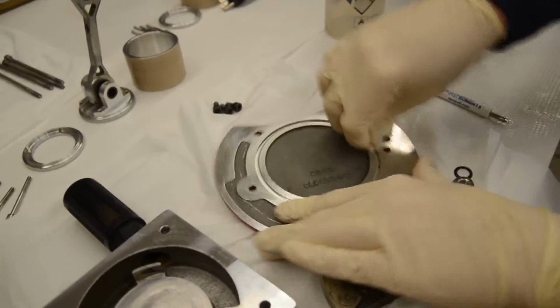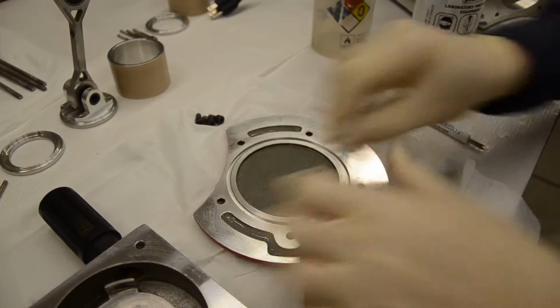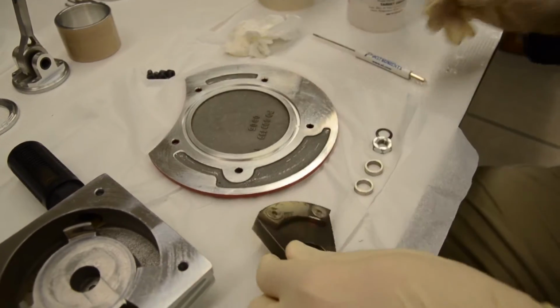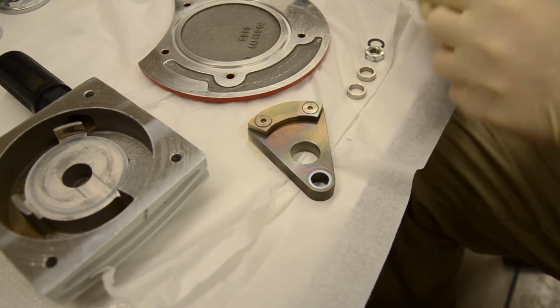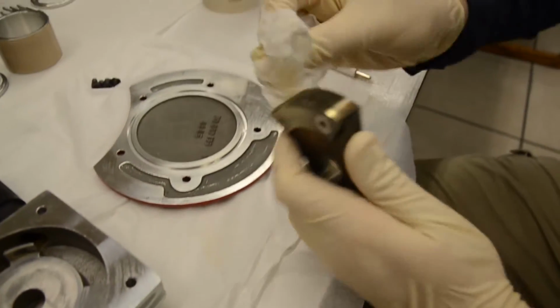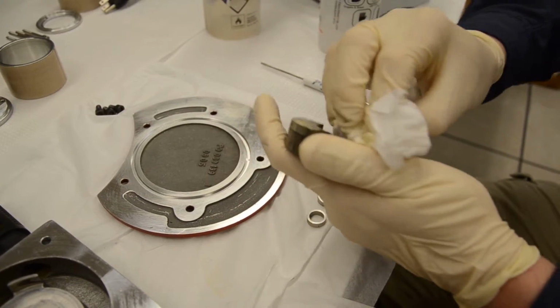As you can see, we have quite a bit of debris that has found its way into the O-ring groove. We can't have any of that. And then the next piece is this weight. It's got a lot of Teflon dust on it. And once we clean this guy, we'll also clean these other assembly components right here, the washer and nuts, and we'll be all done.